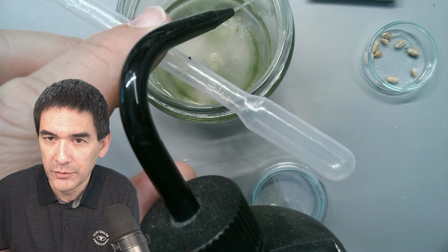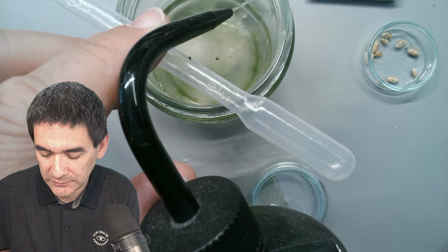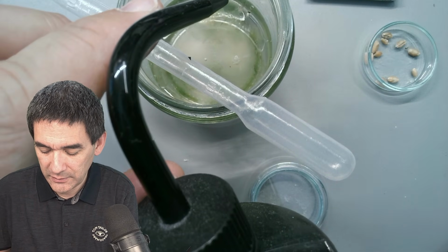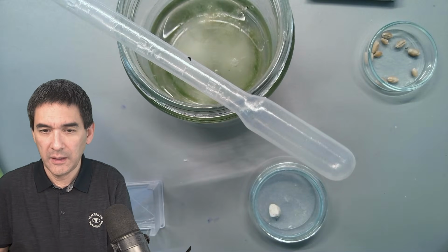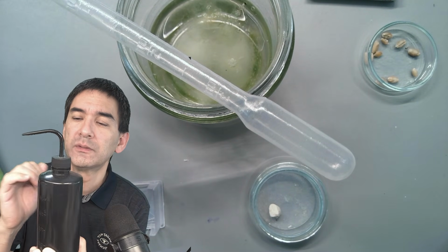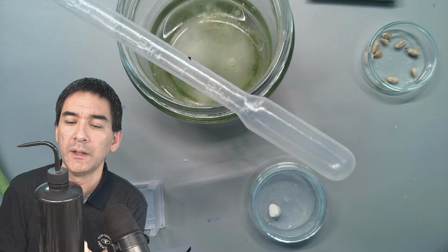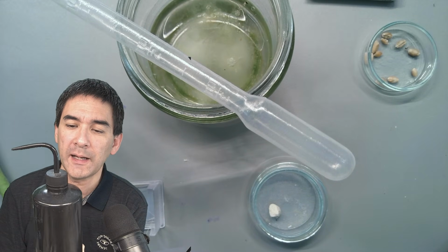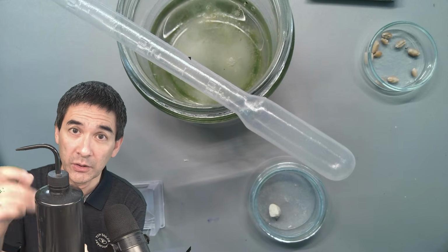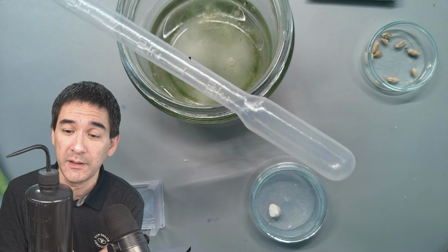Okay, simply to replenish the water. And I think that's going to be enough. Okay. Yeah, look, I'm using this black water bottle here on my desk because I don't have running water. It's a little dusty already. The reason I'm using a black water bottle to store water is to prevent the growth of algae. I've also had clear water bottles and then they start to form a biofilm in there.